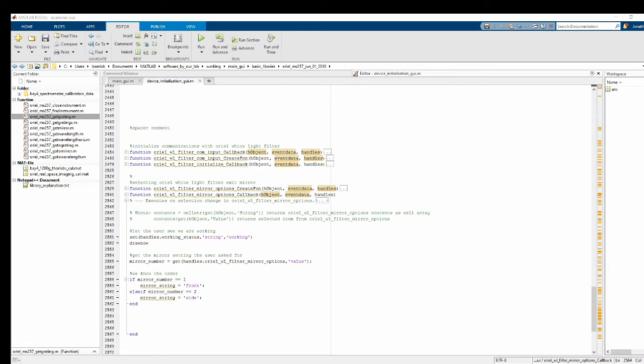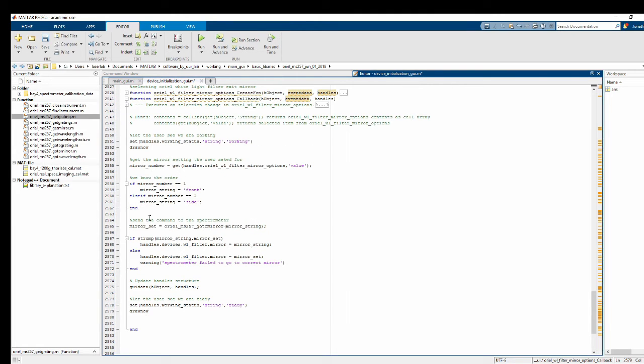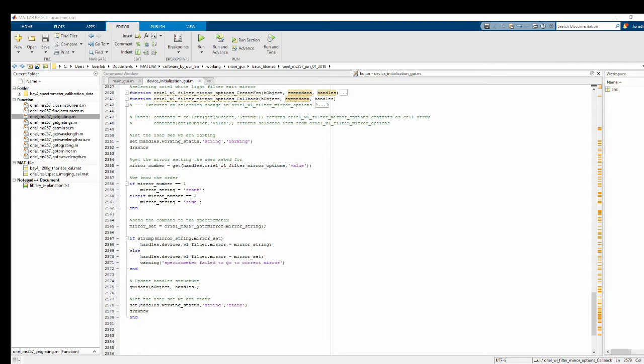And let's just go ahead and copy the rest of this all at once here. Send the command to the oriel spectrometer, so I'm sending it either front or side to tell it which exit port I want it to use. And then compare and see, all right, did we get what we requested? If so, just record it in the devices structure as white light filter.mirror. If we didn't get what we requested, still record what we got, but just warn the user something went wrong. And then again, GUI update data and let the user see we are ready to go. Okay. All right, let me check my notes here. All right, code disable enable on open function. Okay, so next up, let's just go in and test this as it is right now.